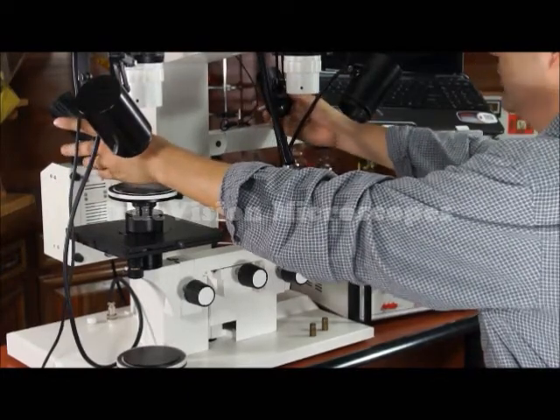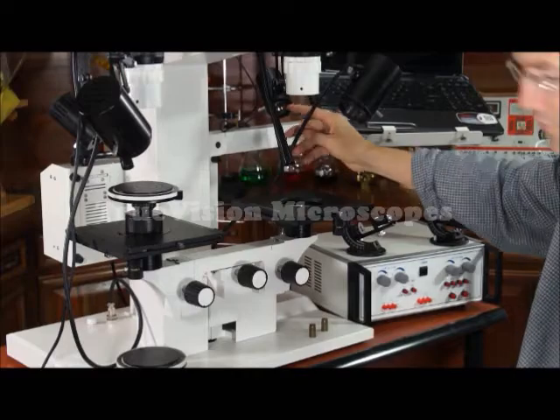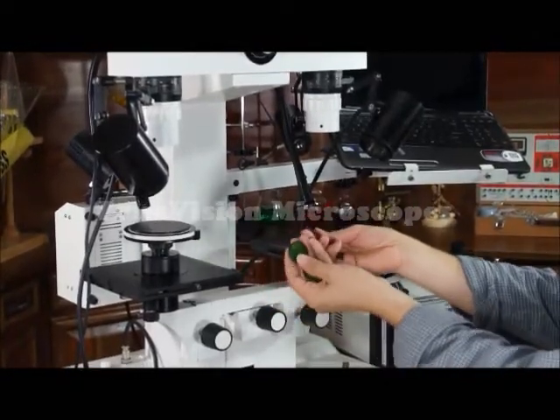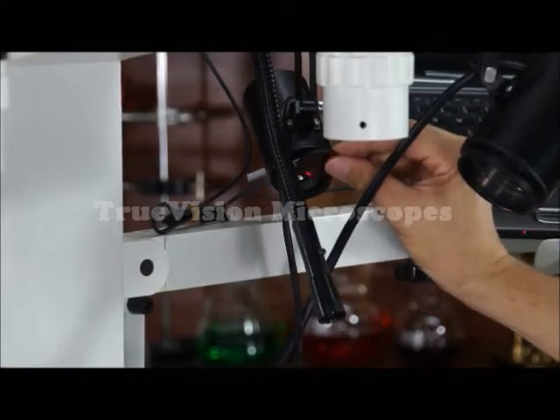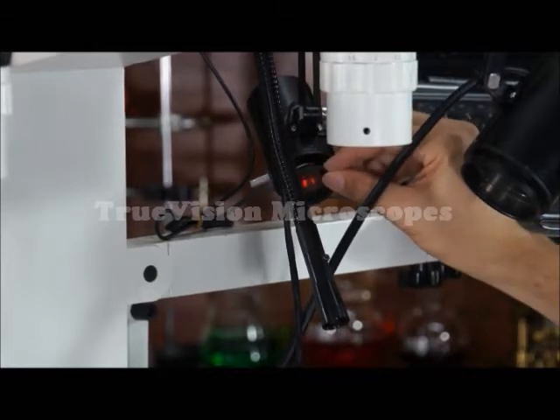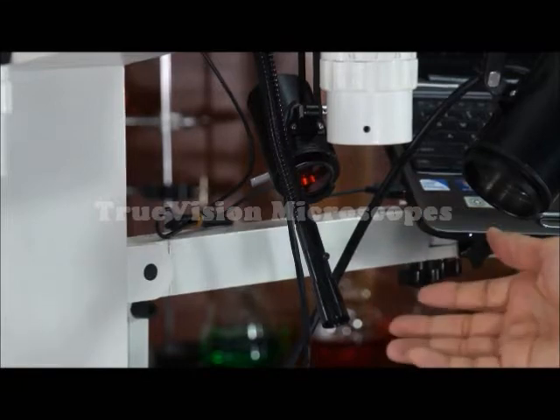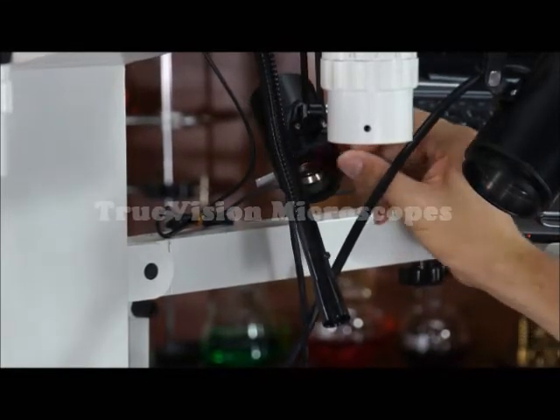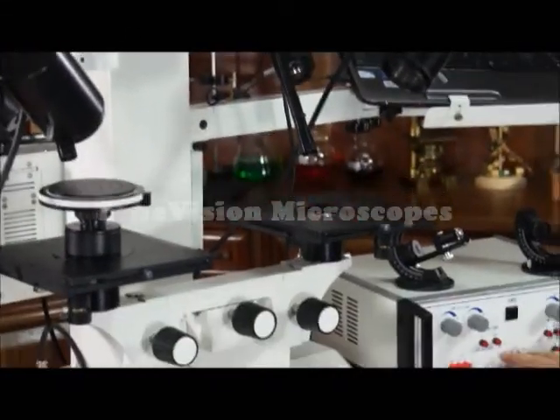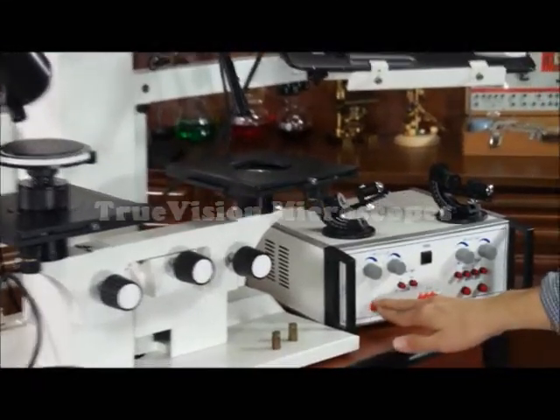This is solely white light, but I have filter holders. I have a red and a green filter. These can be inserted in the filter holder. That simply changes the color of the light. To change the color of these illuminators, I use my knobs on my control panel. White light, red light, green light, blue light.